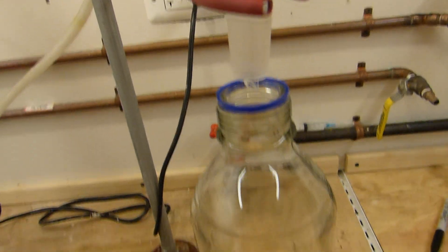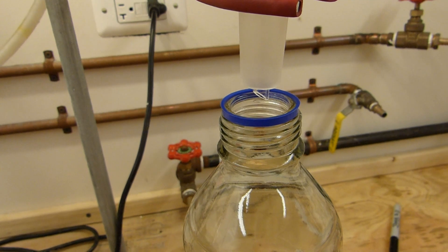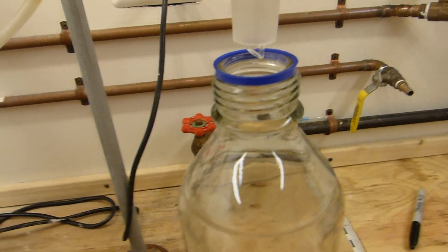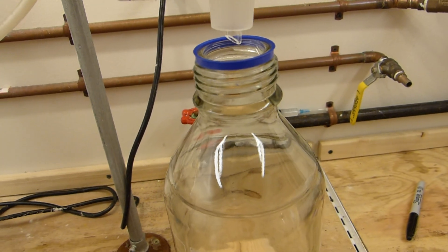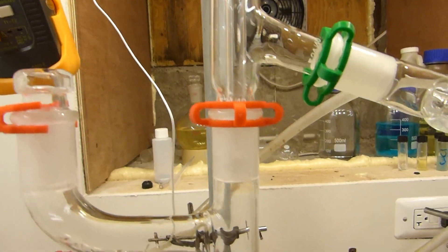The collection jar, nothing too special about this. I've just got it stood up on a block so the drop doesn't have to fall nearly as far. Ethylene glycol will pick up water from the atmosphere, so it's probably best to keep it in close proximity I guess.